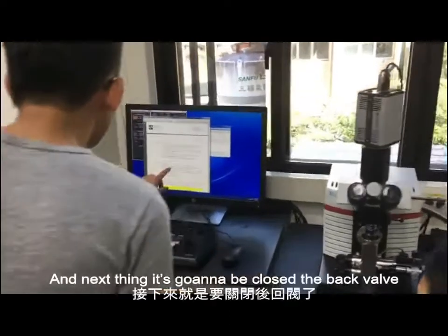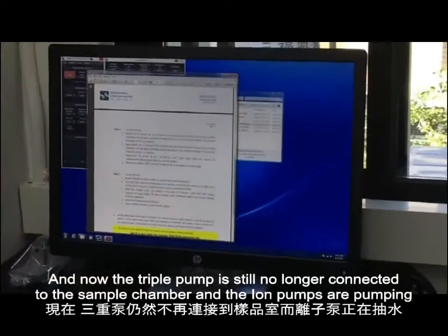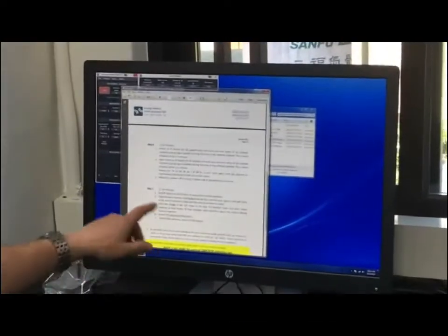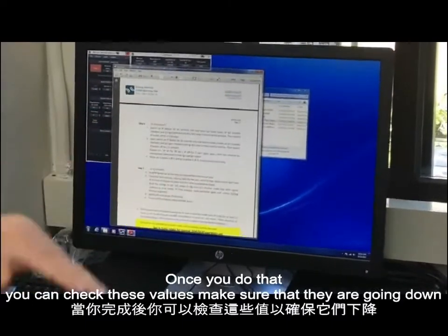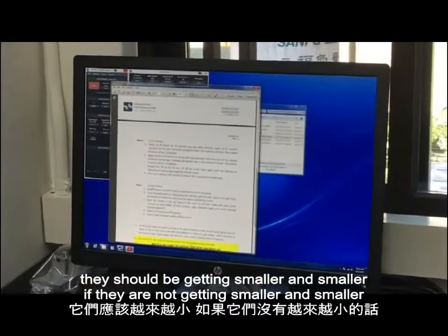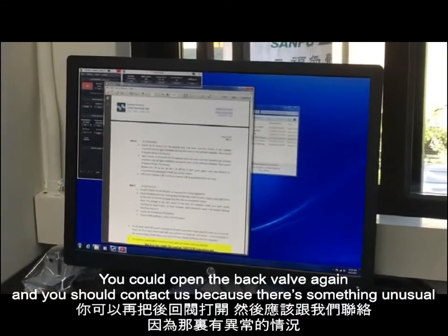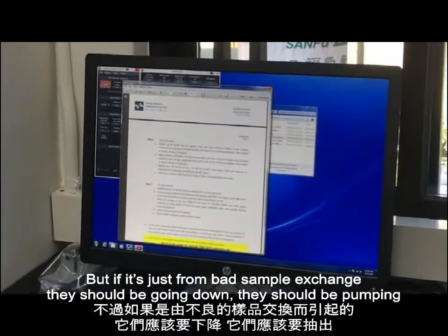And then the next thing is going to be close the back valve. So same thing in reverse, you turn it the other way until it stops, and now the turbo pump is no longer connected to the sample chamber and the ion pumps are pumping. Once you do that, you can check these values, make sure that they're going down. They should be getting smaller and smaller. If they're not getting smaller and smaller, you could open the back valve again and you should contact us because it's something unusual. But if it's just from bad sample exchange, they should be going down, it should be pumping.